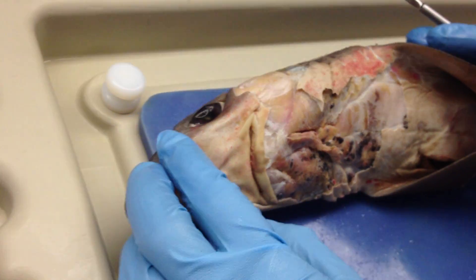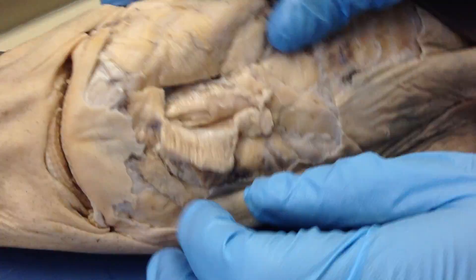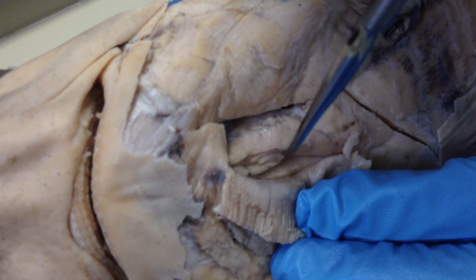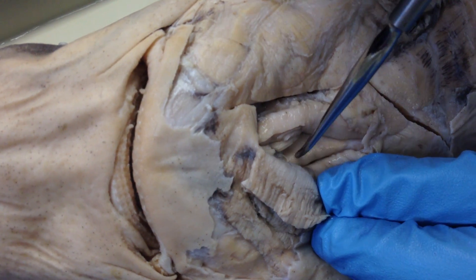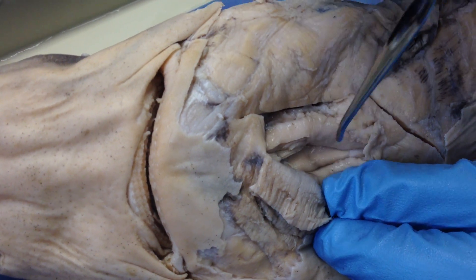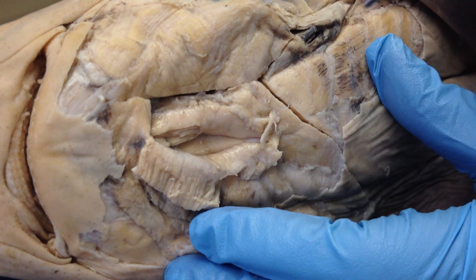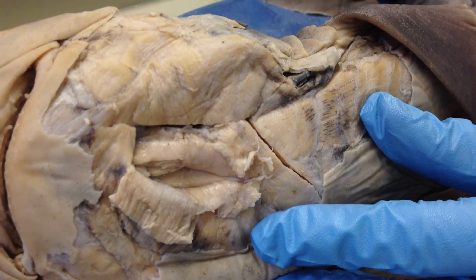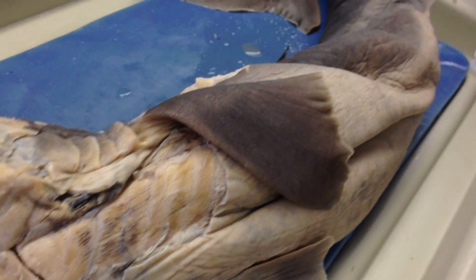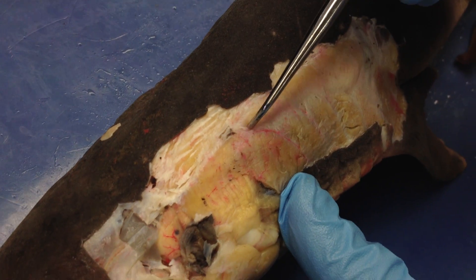The coracomandibularis is its first thick tube. Right underneath that is the coracohyoid, and following down caudally is the coracoarcualis. The cucullaris, seen on this shark, is located right here.